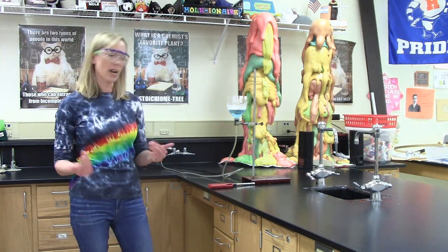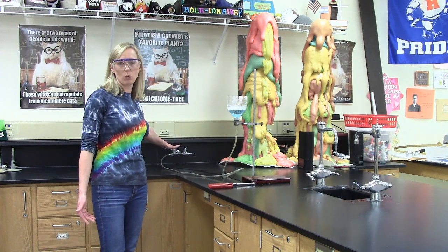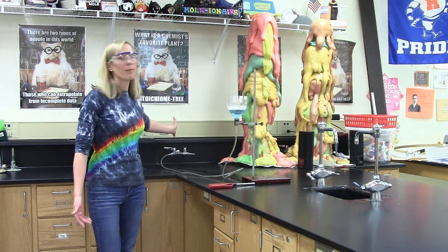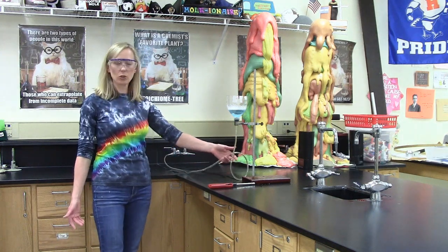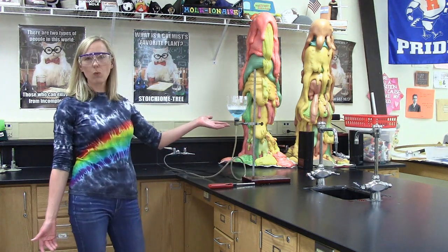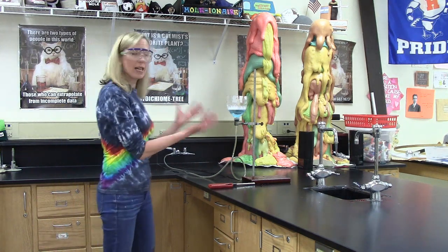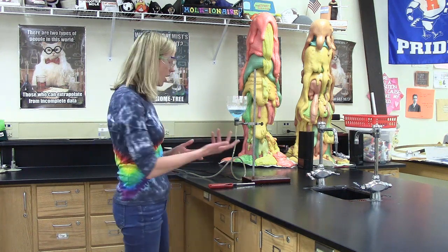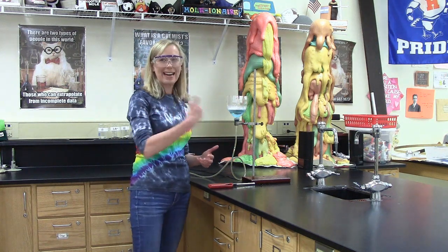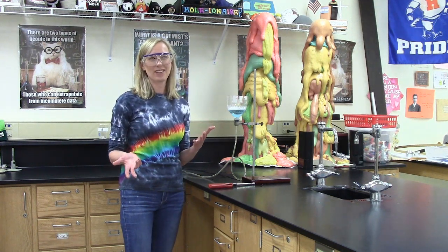So here's what we've got. I'm going to turn on my gas valve, which is over here by the wall. And when I do, methane, CH4, is going to bubble through this tubing and into some soapy water that I've got in this little contraption. So the methane should get caught in the bubbles, and then I'm going to try my best to get my hand wet and light the bubbles on fire. So let's see if this works.